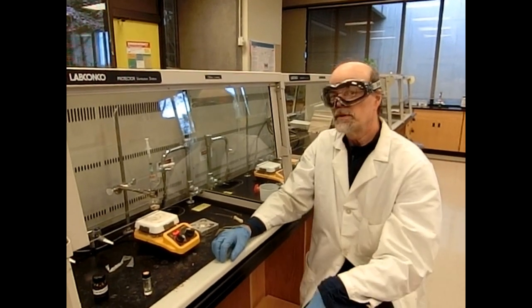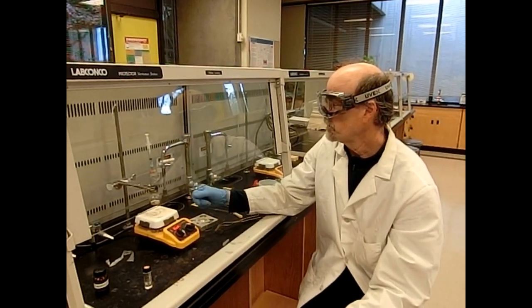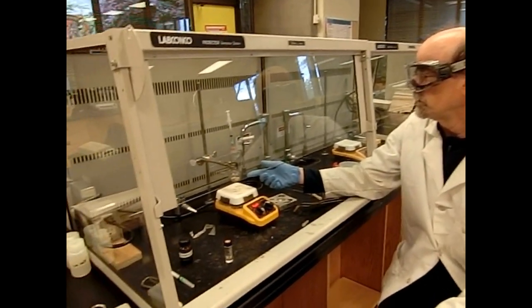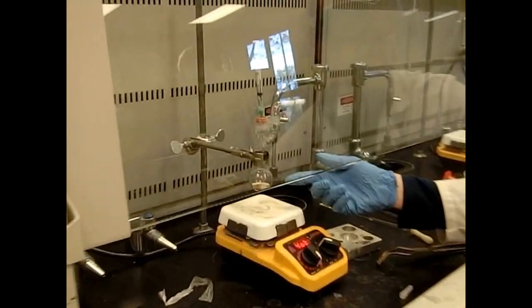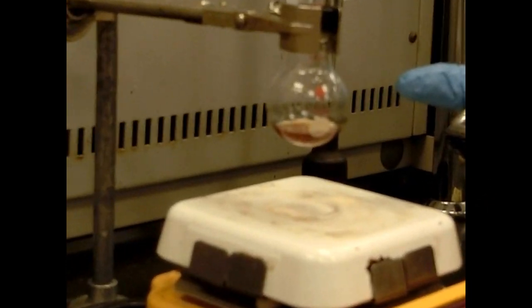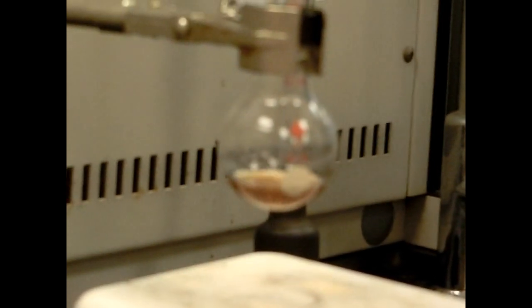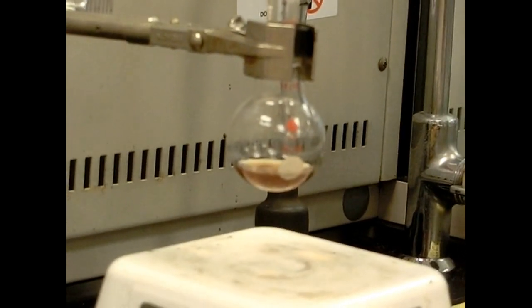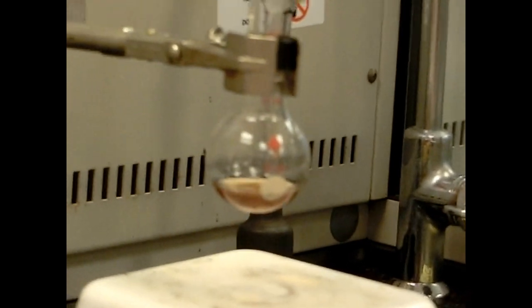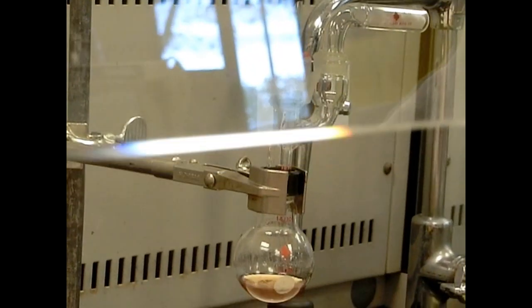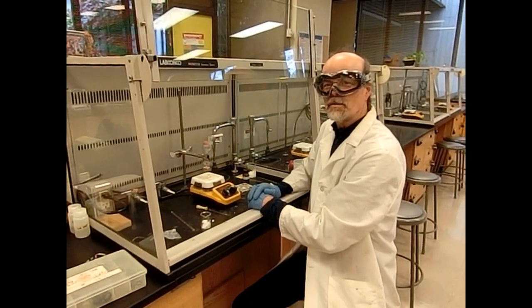Here we're getting pretty near the end. We're not boiling quite as readily as we were. The solution's a nice dark brown color. We've consumed some magnesium. And I've added almost all of our bromobenzene. We'll maybe finish this off. This will be the last of the bromobenzene solution. And once we do this, we'll wait about five minutes or so for the reaction.